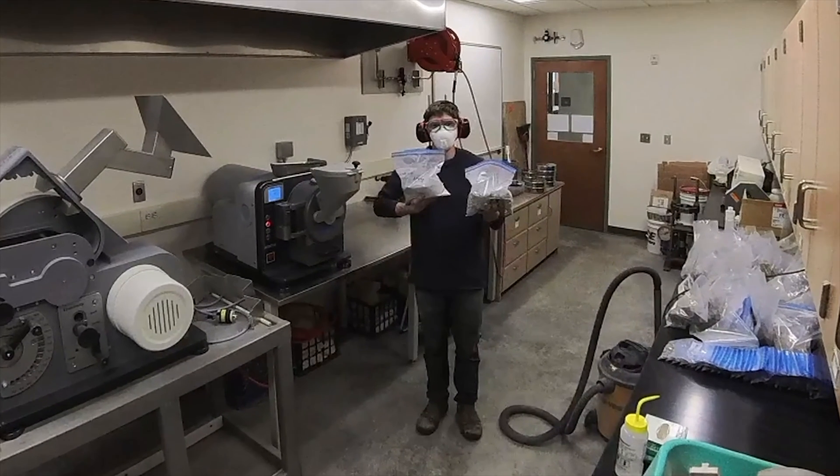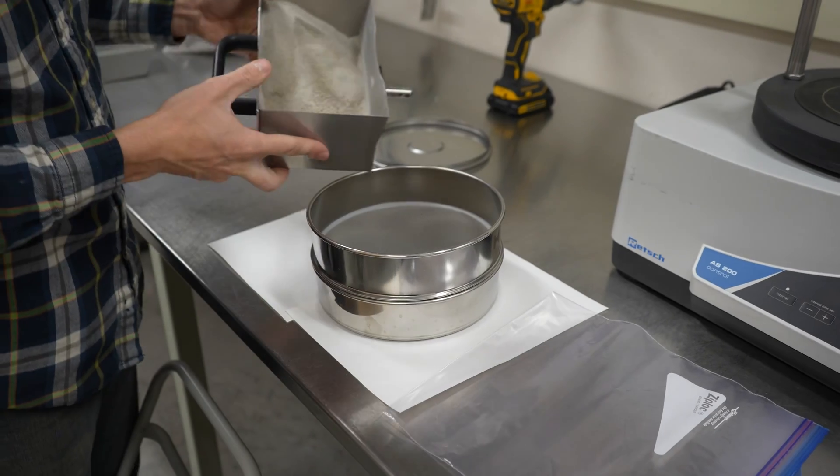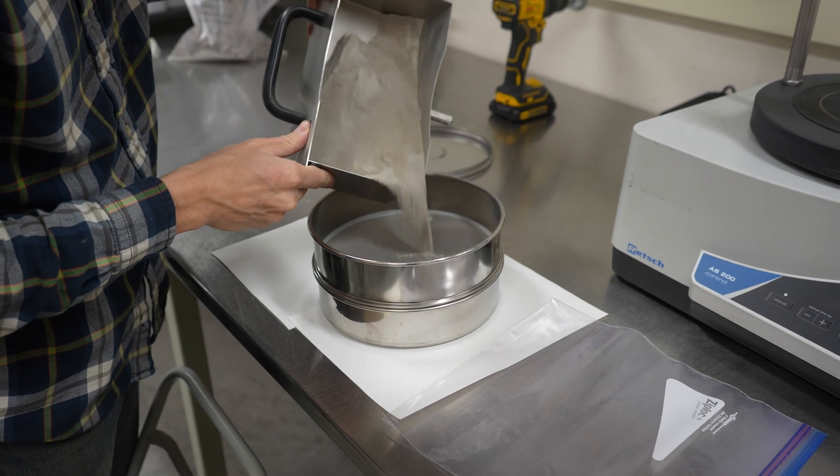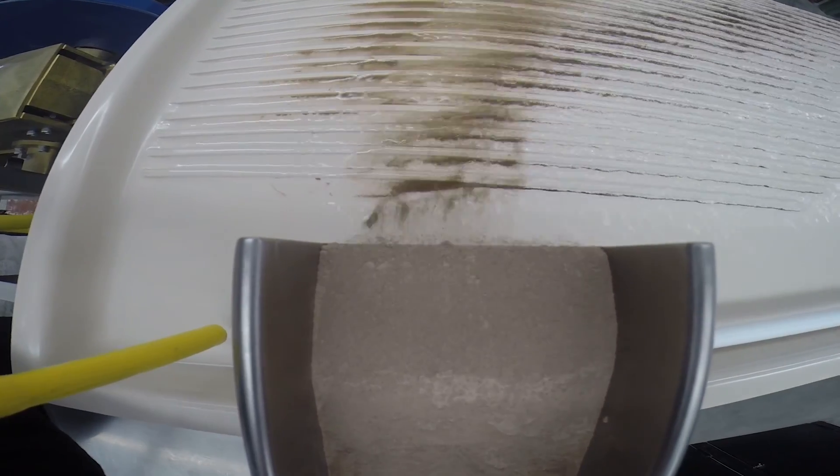Now that we transformed our rock sample into a fine powder, it is time to separate out the zircons. Only a small percentage of the millions and millions of grains of rock is zircon, so this process is quite labor intensive.